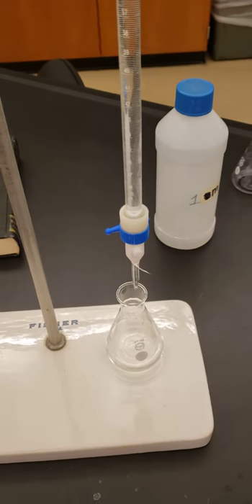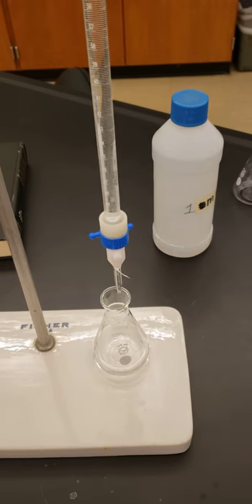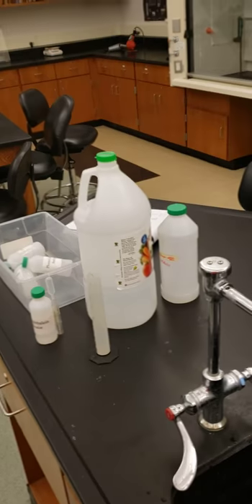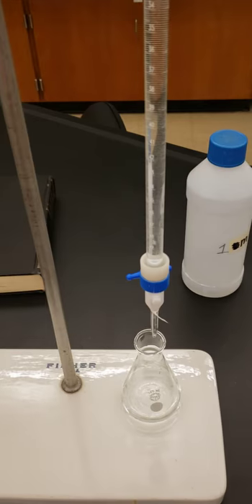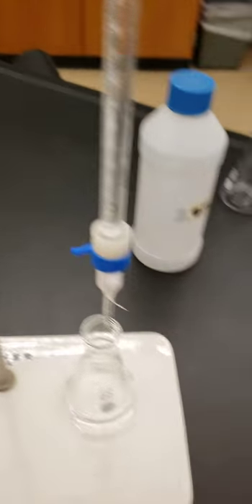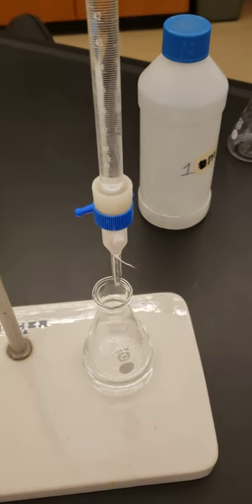For lab 12 we've got a titration of a common acid. What we're using for our common acid is household vinegar, as you can see over there. Into the household vinegar I have added a small quantity of the indicator. This time the indicator is called phenolphthalein.